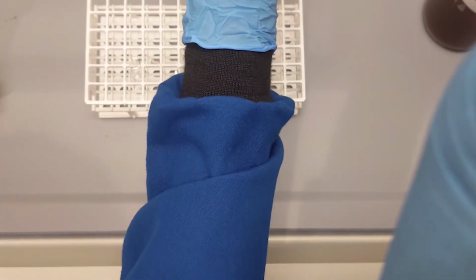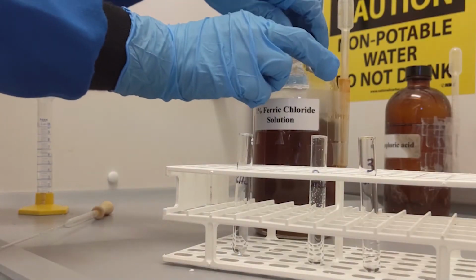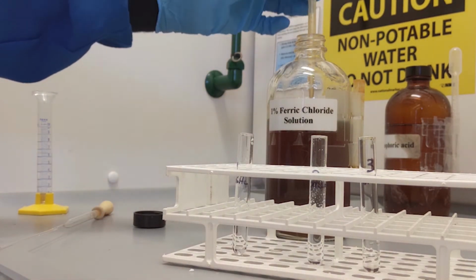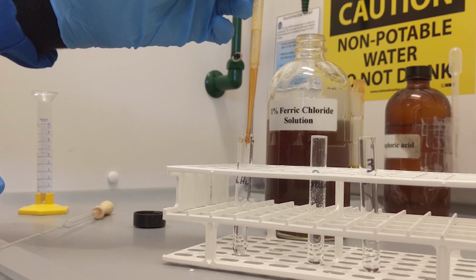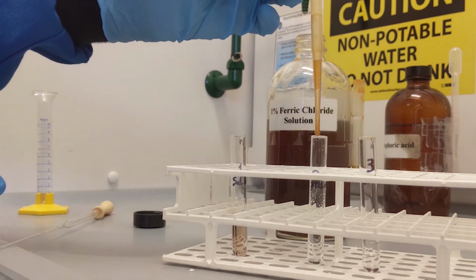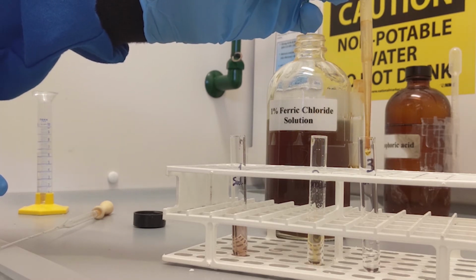Since ferric chloride test gives a positive result in the presence of phenols, it would give a positive result in the presence of salicylic acid. If your product does not give any color, it means that you do not have any starting material in your product, which means you have synthesized aspirin by using all of your starting material. Upon the addition of a few drops of the ferric chloride solution in each test tube, you will see a color in the salicylic acid tube, no color in your product tube, and a similar no color in your control.